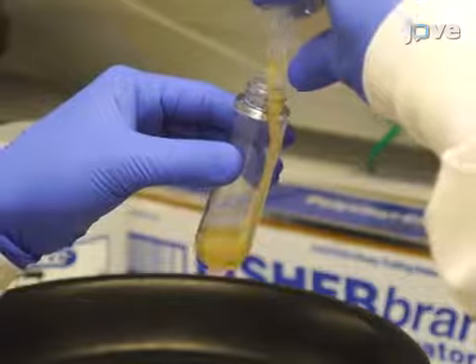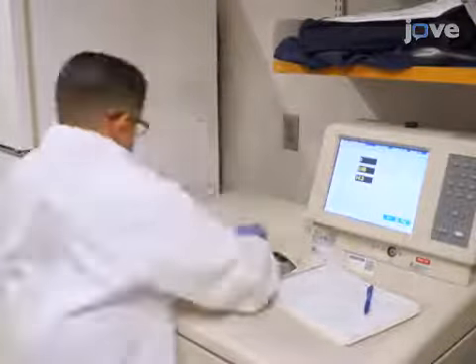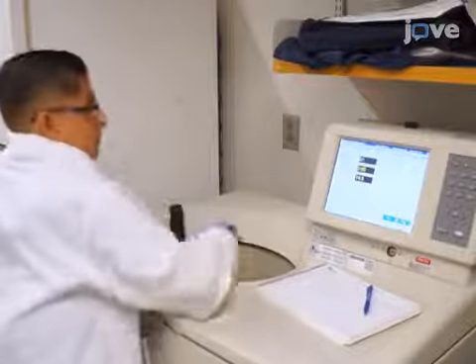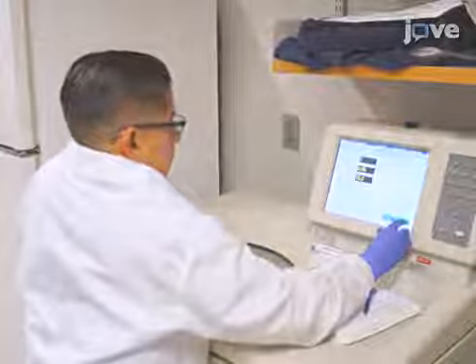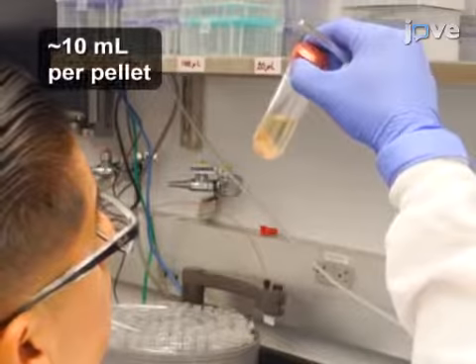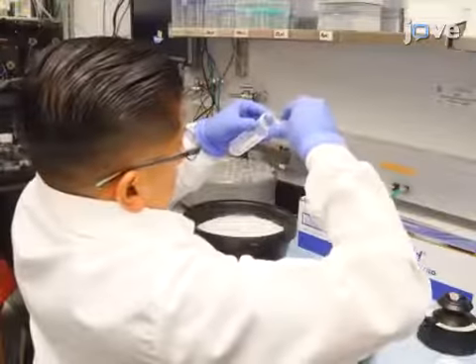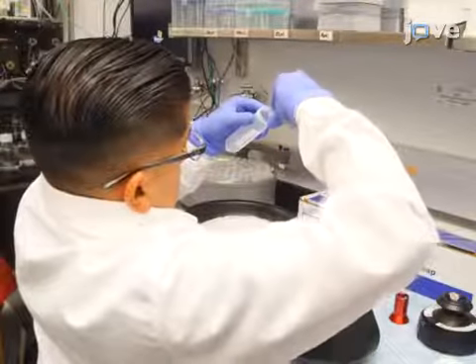After sonication, transfer the cell sample to a cold ultracentrifuge tube and spin at 120,000 times G for 60 minutes at 4 degrees Celsius. Following centrifugation, there should be an obvious pellet and the supernatant may have a yellow color. Transfer the supernatant into a cold 50 milliliter conical tube.